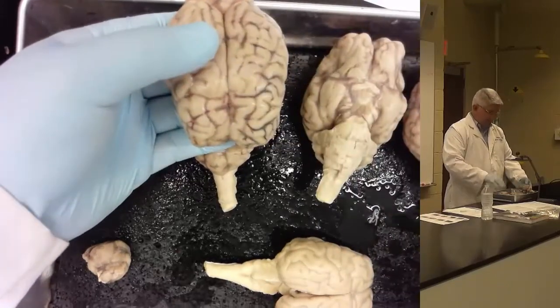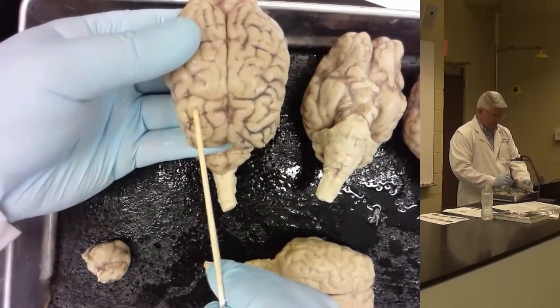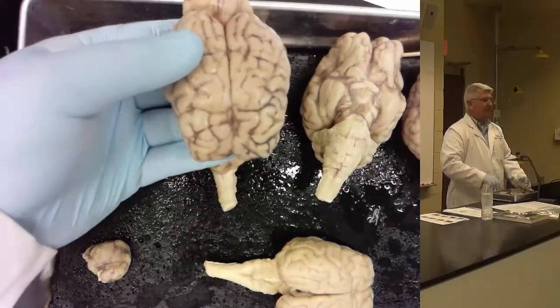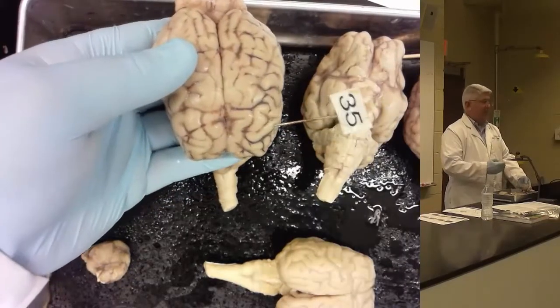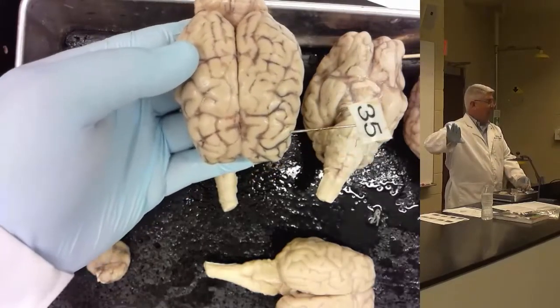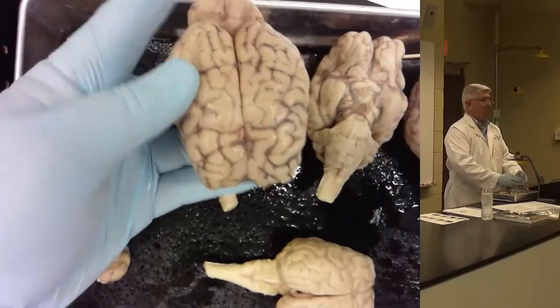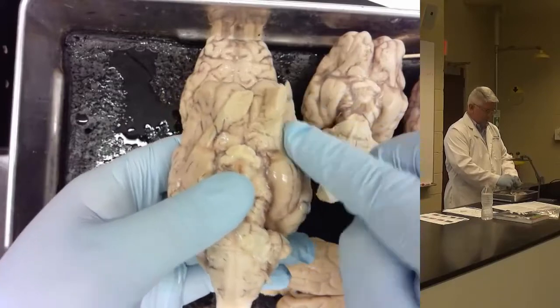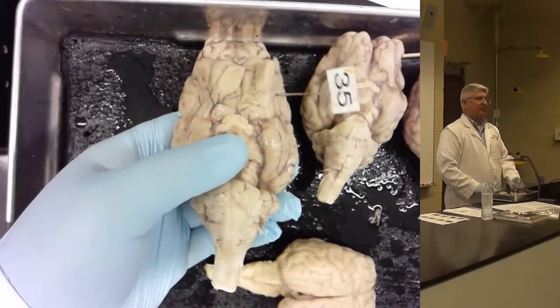On the other side, it goes in the same direction away from the midline. So superior, middle, inferior. Now I'm going to tell you something that people get mixed up, and hopefully no one in here will get it mixed up. Because if I have a pin stuck kind of over here in the side, you orientate and say, okay, top of the brain, lateral most part, that should be inferior frontal gyrus, and you're correct. Okay? On the bottom part of the brain, there's this place here which we call the orbital gyri over here.